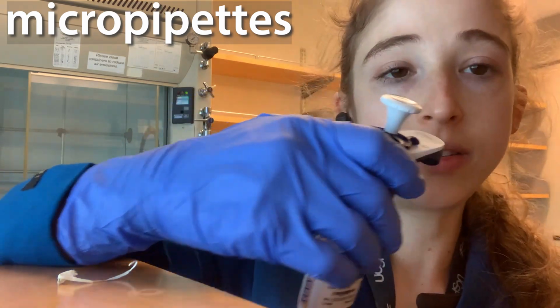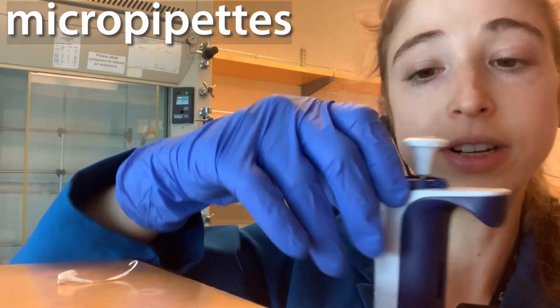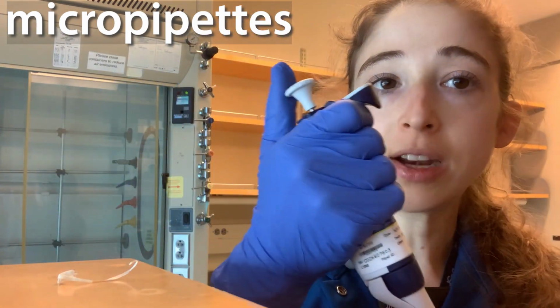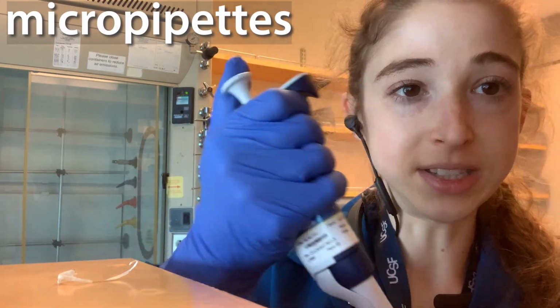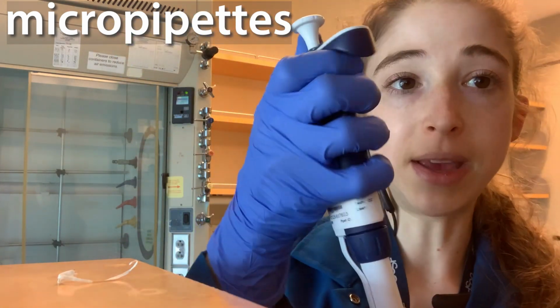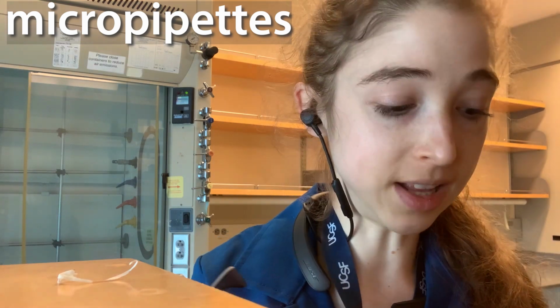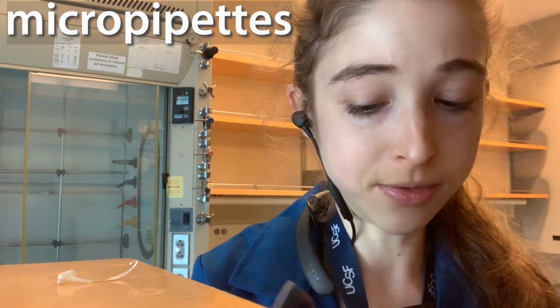To adjust one of these, they often have a lock, so it'll be tight to make it harder for you to accidentally turn it. But then you can just unlock it and turn the dial until it's where you want, and then make sure you lock it back up. When you're pipetting, you probably have a tendency, I know I do, to accidentally turn it if it's not locked in place. So another good practice is to periodically look and make sure that you haven't shifted the dial. This can happen really easily, especially if you're pipetting a lot of samples over and over. I always check to make sure that it hasn't turned, because then your sample volume is going to be off.